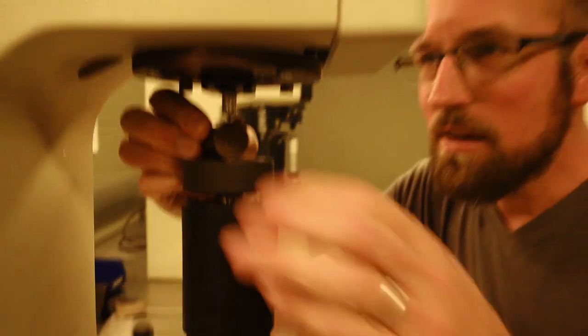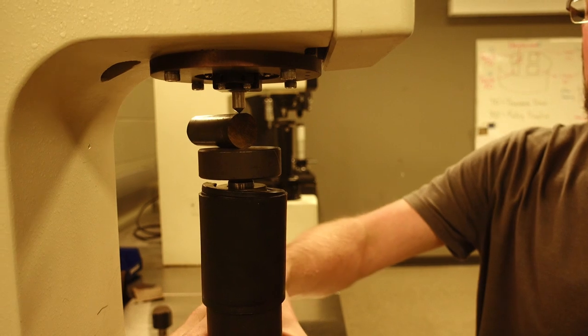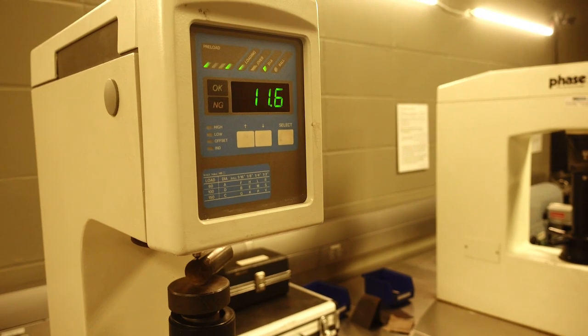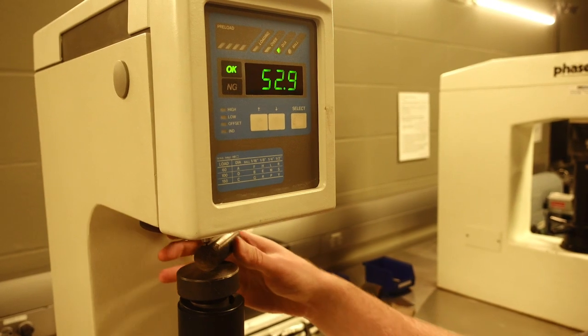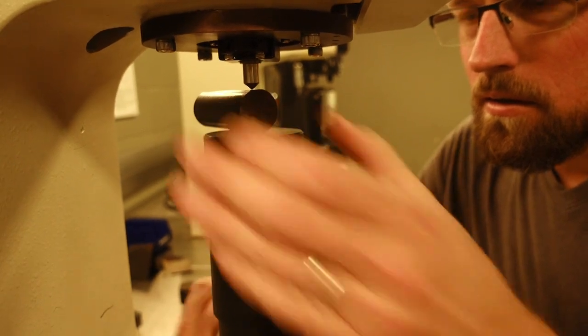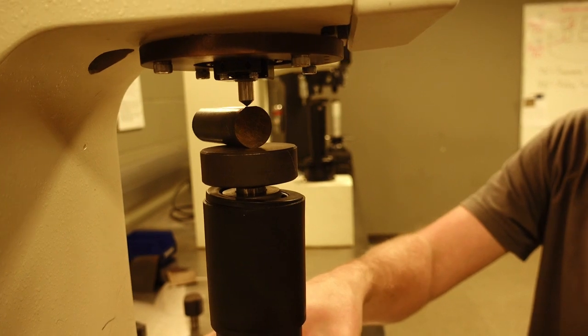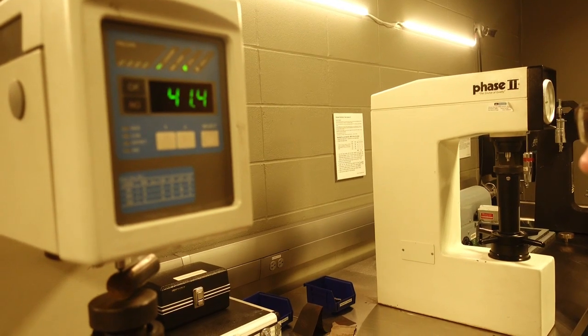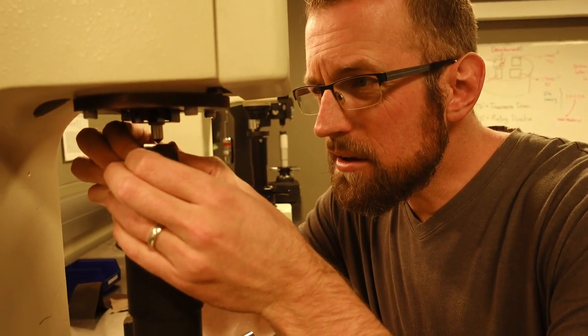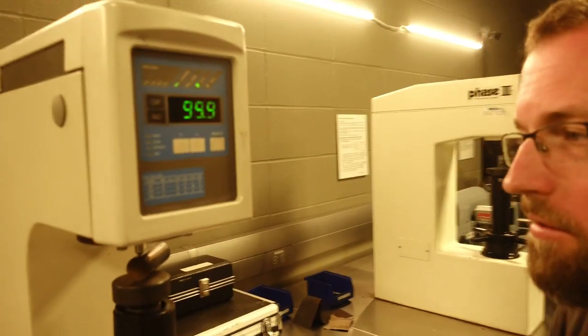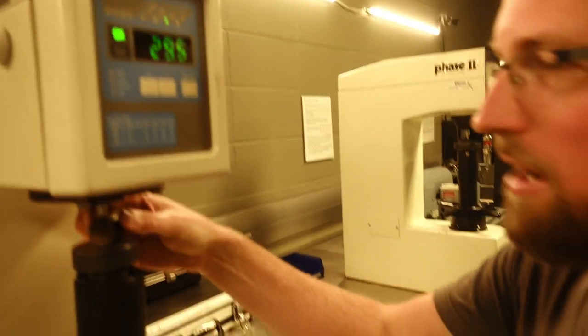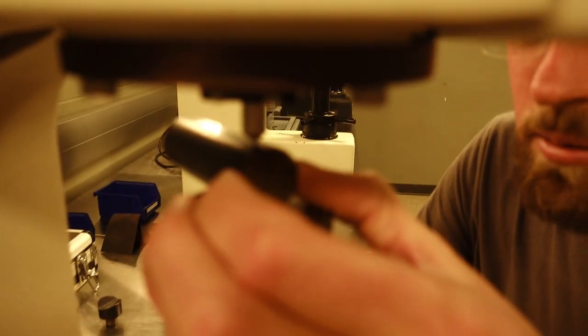Already down to 55.0. 52.9. 41.6. Now we're properly dropping off. And it's going to continue to drop as the percentage of martensite decreases. So now we aren't dealing with 100% martensite anymore. We have a mixed microstructure of martensite and probably some ferrite in there as well.